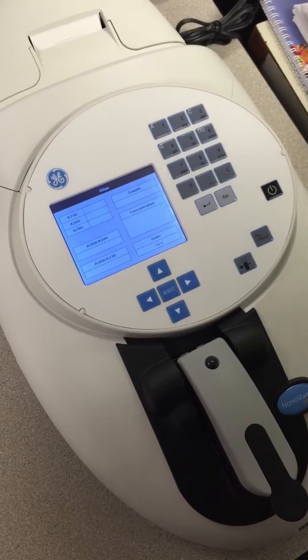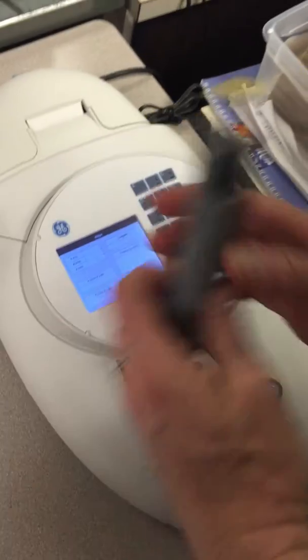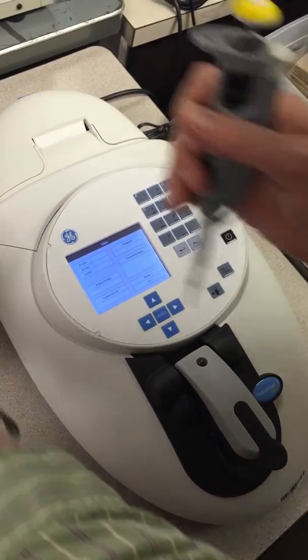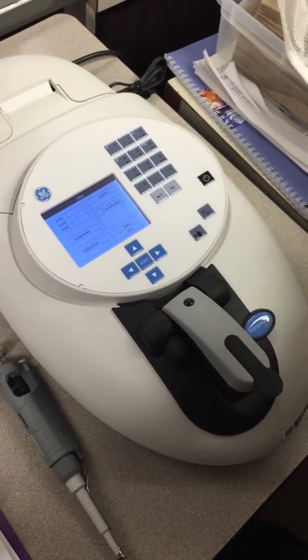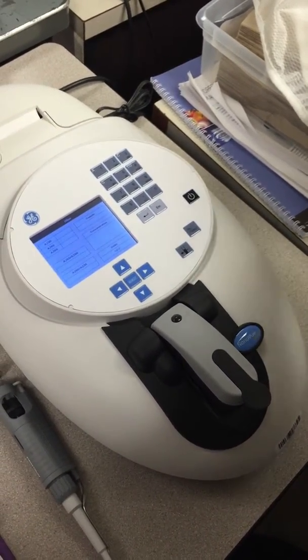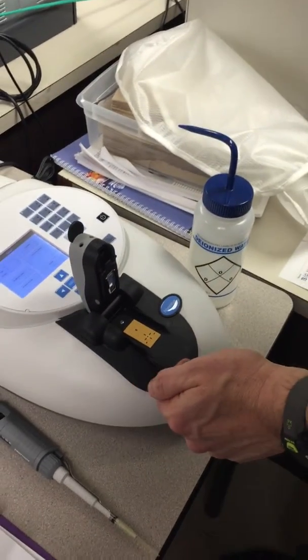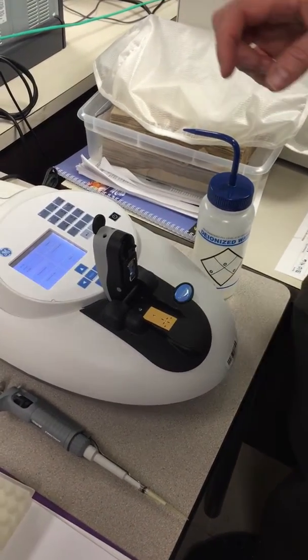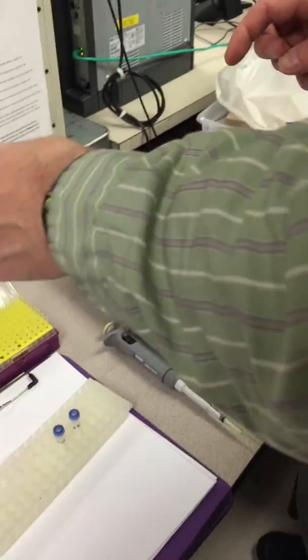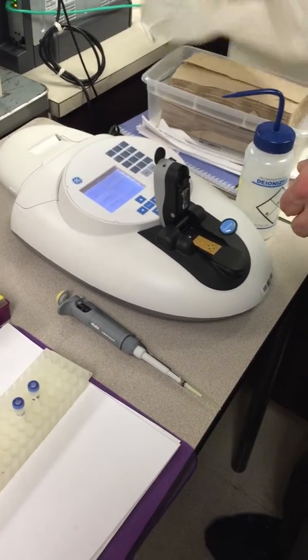The next thing I have to do is I have to blank it, which I think is one of these two buttons. We'll figure out which one it is in just a second. I'm going to take some water here, and typically what I'm going to do is take some of this water that we have and just make sure that the surfaces are actually clean and that the last person who did it didn't leave a little bit of residue behind. Usually there's a little bit of Kim wipes here, but they're missing. If we had Kim wipes, I would do that.